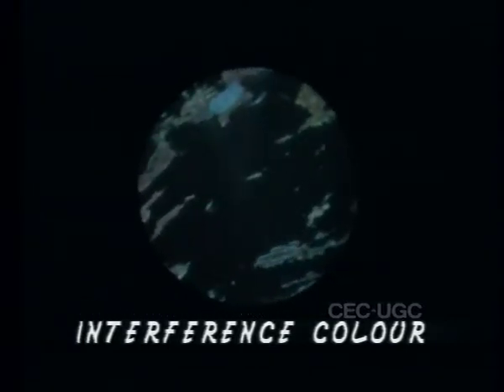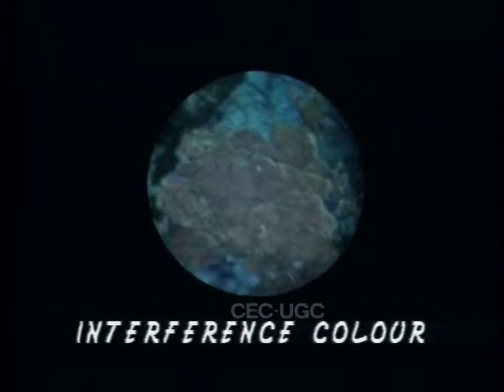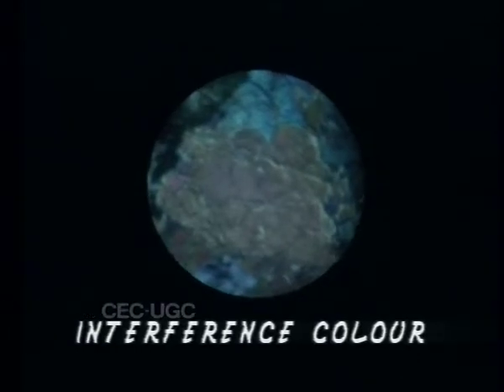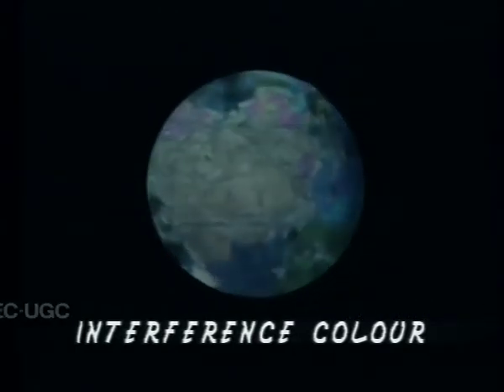Hence, isotropic minerals remain dark in all positions during rotation of the stage. Anisotropic minerals, however, modify the vibration direction of incident light by double refraction. This tendency to modify the character of incident light varies with the rotation of microscope stage, causing change in the appearance of the mineral.